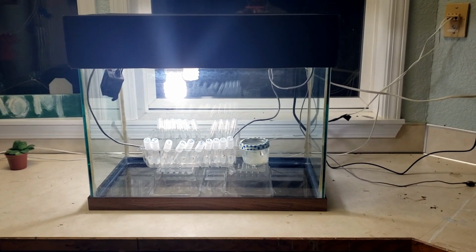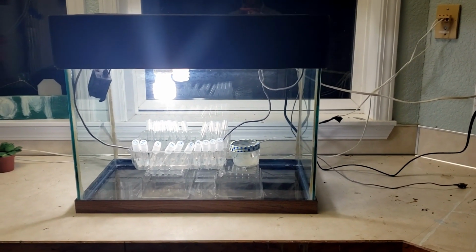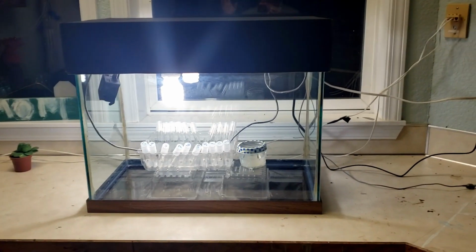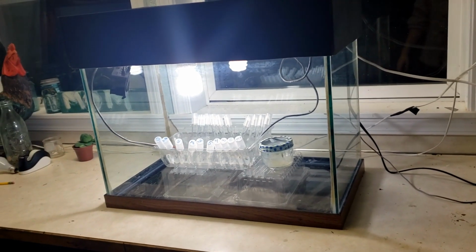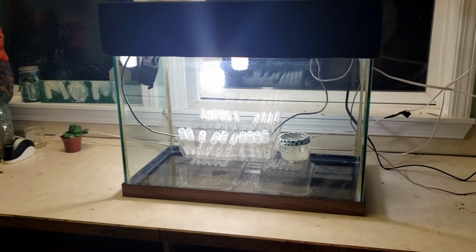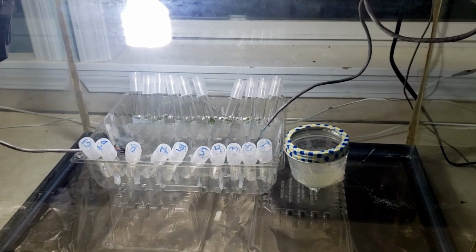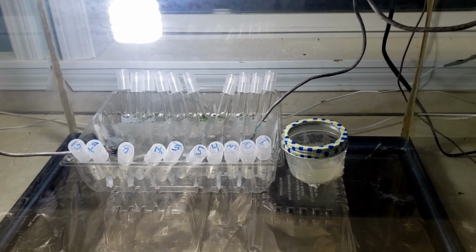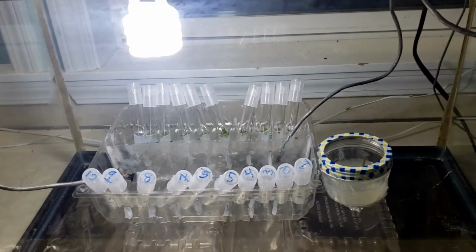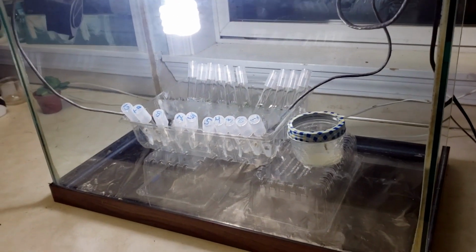Okay, here is the environmentally controlled tissue culture growing box, I guess is what you could call it. It's all automated, but I'll give you a quick overview of each of the main components, and then I'll crack the hood here, and I'll show you the brains behind the whole operation. So as you can already see, I already have the tissue cultures in the tubes and in the growth medium. I'll be covering all that in the second video, how I did that and the process there. But now I'm just talking about the box and the automation behind it that hopefully will make this experiment work.